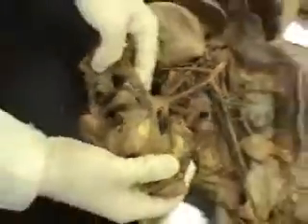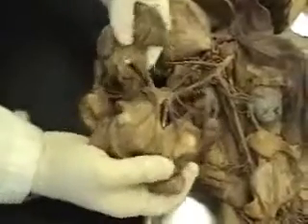This artery, the next branch off the abdominal aorta, is the superior mesenteric artery. The superior mesenteric artery subdivides into many, many smaller branches, supplying oxygenated blood to all of the small intestine. And you can see all these branches in the mesenteries of the small intestine. The mesenteries are the name for the membrane that holds these loops of the intestine together.